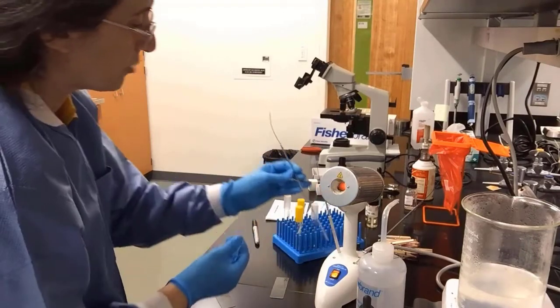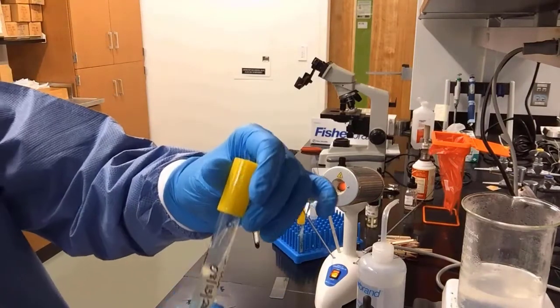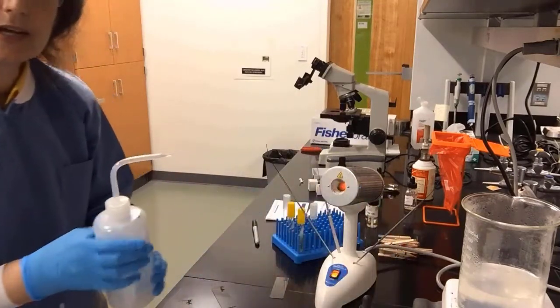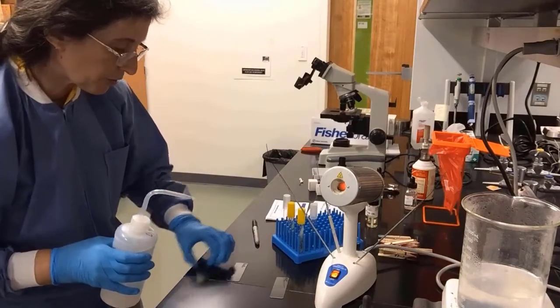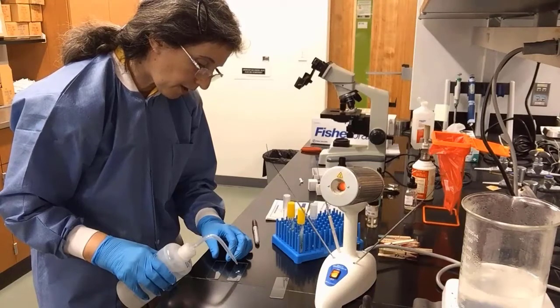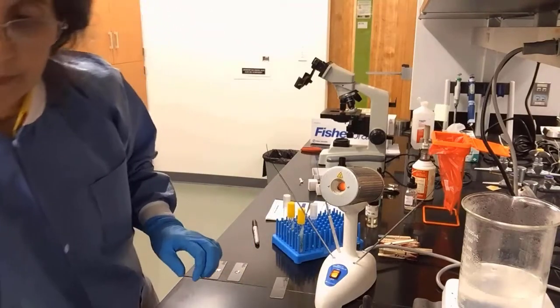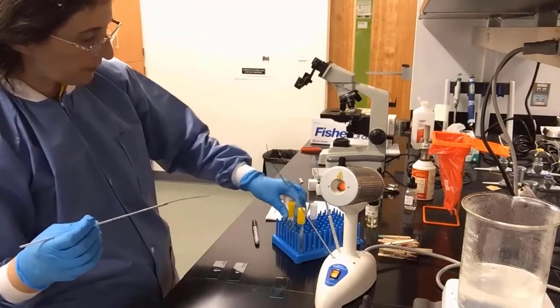And now we will move on to our Staphylococcus aureus slant. Now notice this is going to be very concentrated because it's more slimy and there's a more concentrated look to the specimen. So we're going to put a drop of distilled water on each one of the other slides, the bacillus and the staph, because we're going to be using the bacteria growing on slants rather than on liquids.